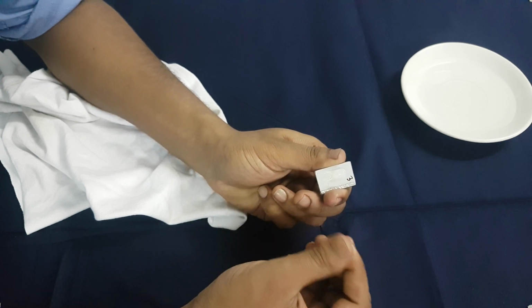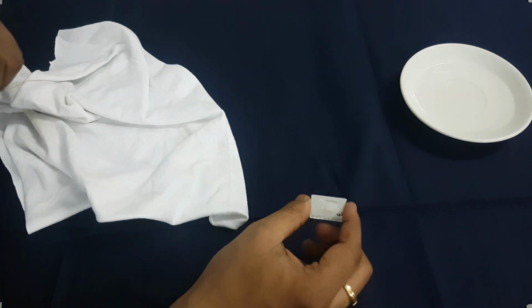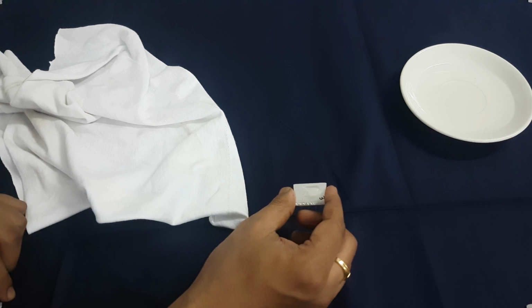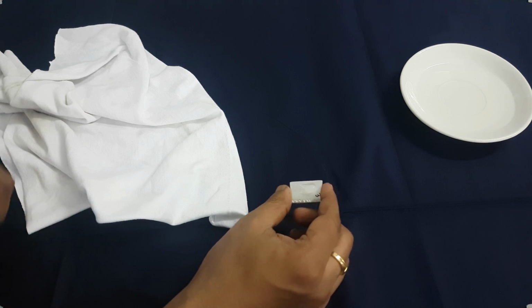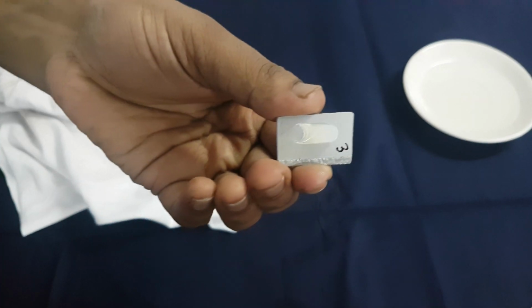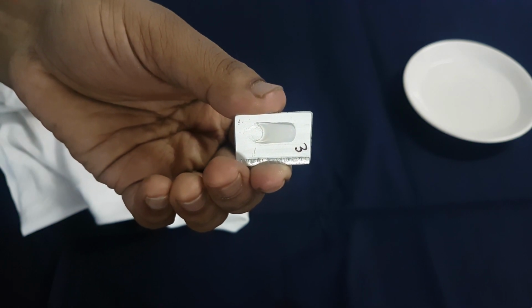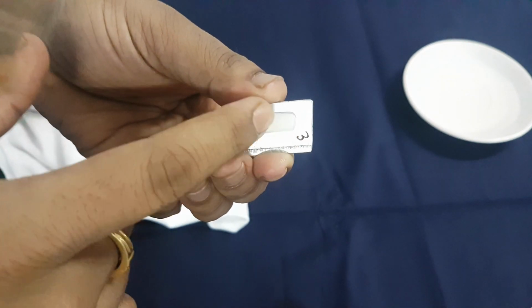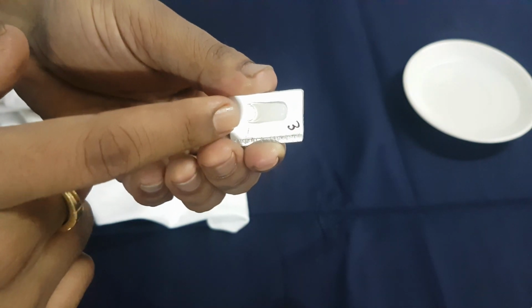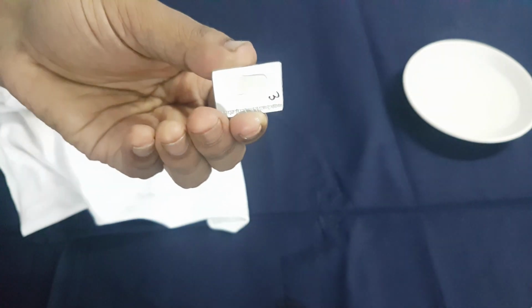I don't know about the dimensional change. We'll see that in just a bit. I'll measure the dimensions and then we'll see whether there is a change or not. Until then, let's assume that this is technically insoluble in the dry part, the dry one. It is dry. As you could see, the wet one could be removed very easily. It's a paste. The dry silicone sealant is insoluble in silicone liquid.